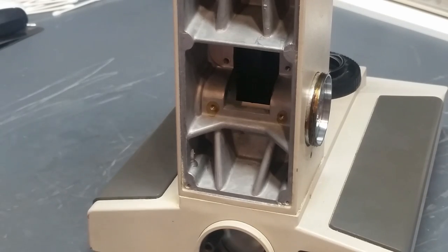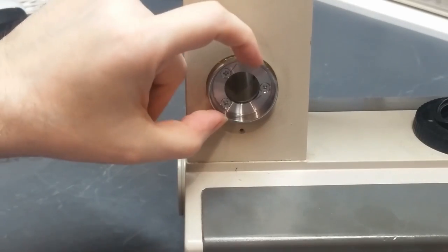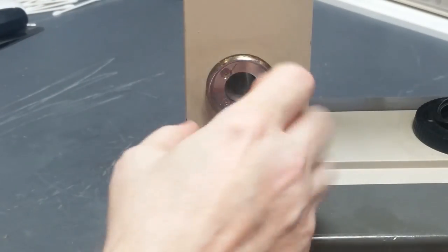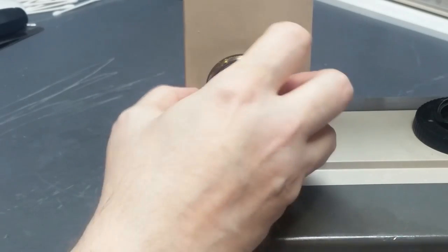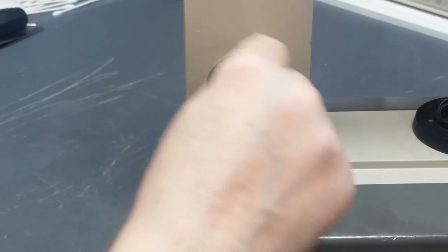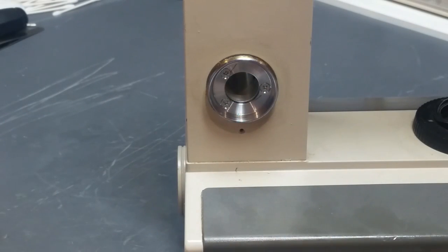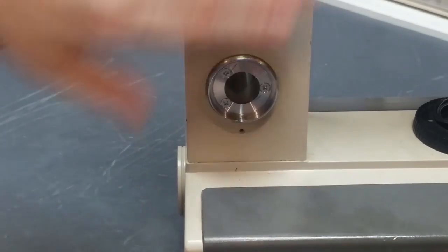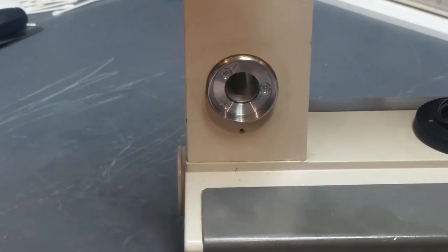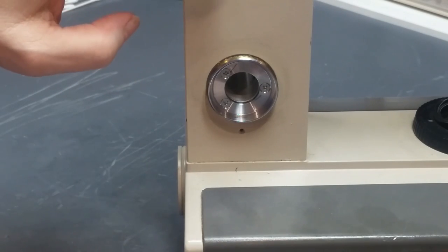Okay, so last step is over here on this side. There's this piece here which is threaded on the outside, and it's what the whole preset lock mechanism screws down around. And it's important that you clean all the grease around the perimeter of this thing thoroughly. And also, it's highly desirable to clean all the garbage off this arm and everything, because as you work, you end up with fingerprints all over it, so you really want to clean that.